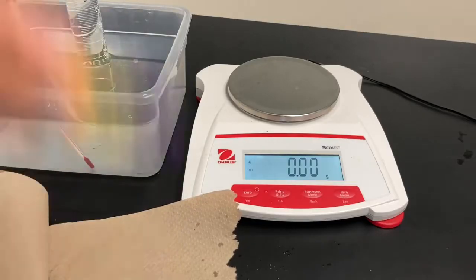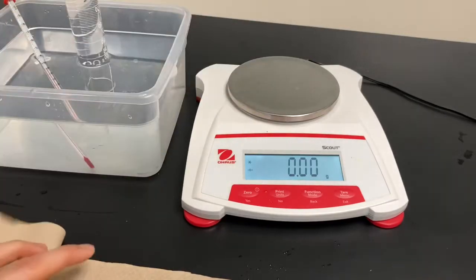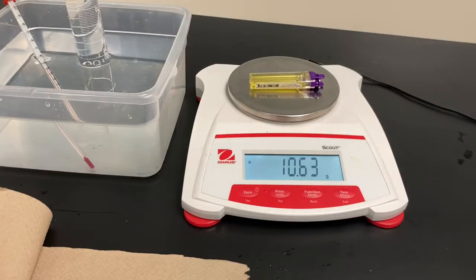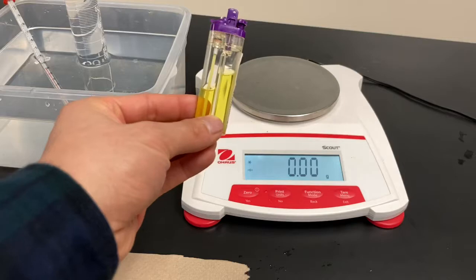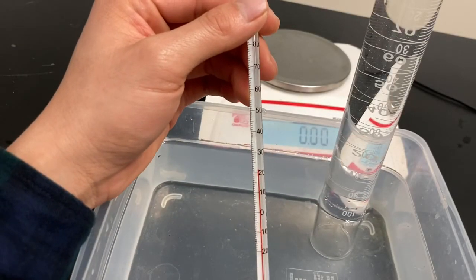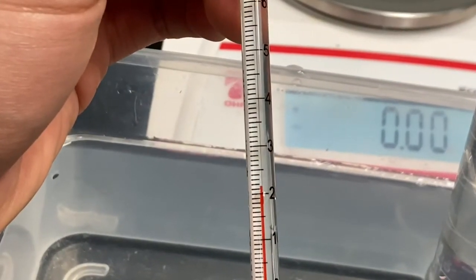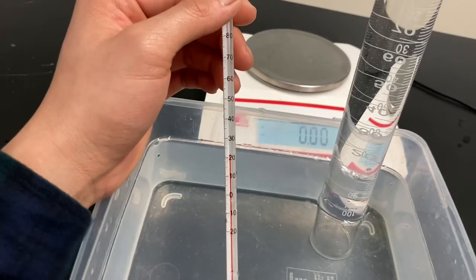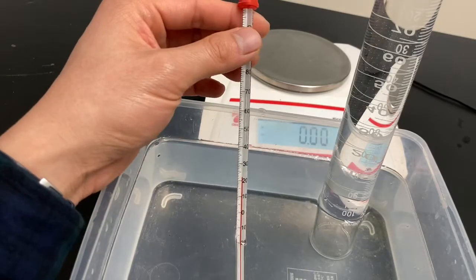After a few more shakes, we take the initial mass of the lighter: 10.63 grams. The final mass will come after I've collected some of the gas. Next, I'm reading the temperature — 22 degrees Celsius — for the water. We're going to use that temperature to figure out the vapor pressure exerted by the water, which will help us calculate the pressure of our gas.